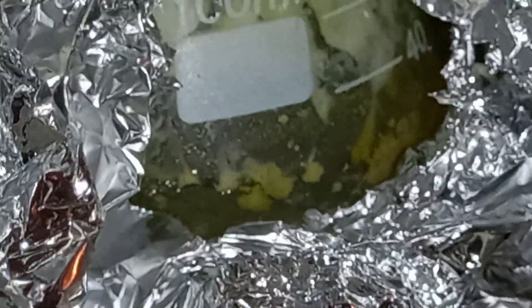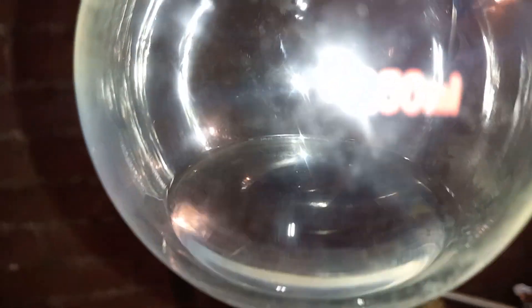It looks like I was right because it's crystal clear pyridine — a little bit foggy, but it looks really nice. Looks like distilled water. The distillation is almost at an end because there's just a little bit of the salt left, and of course it's yellow. But that means all the yellow is there and not here — so that's actually a really good sign. We got rid of the yellow! Here's our hopefully very pure pyridine. It's pretty nice and a decent amount too, so I'm really happy with this.